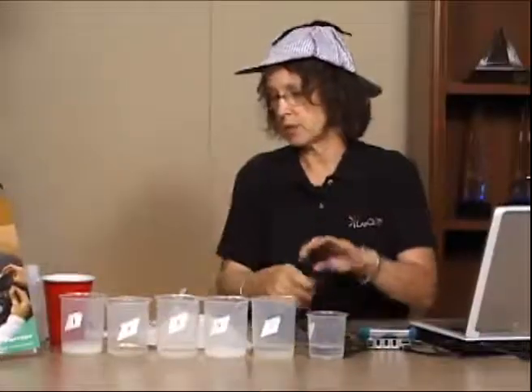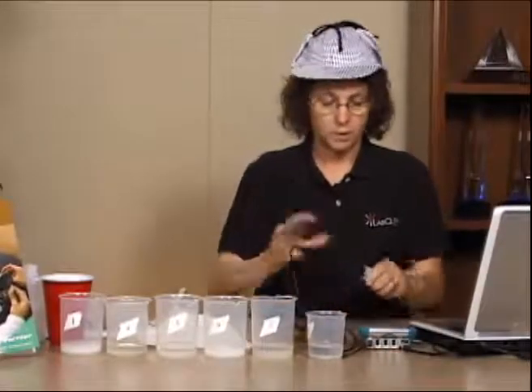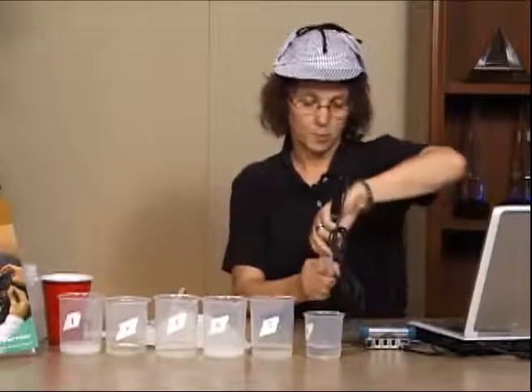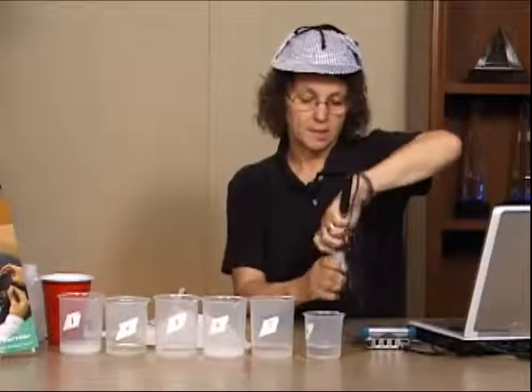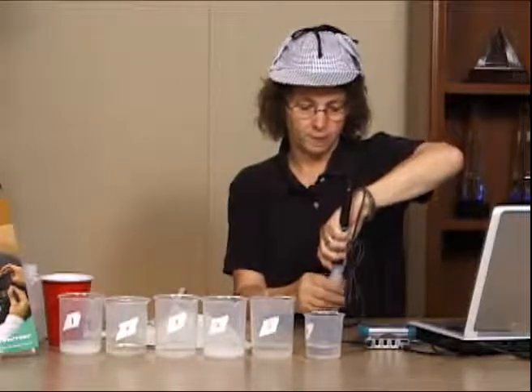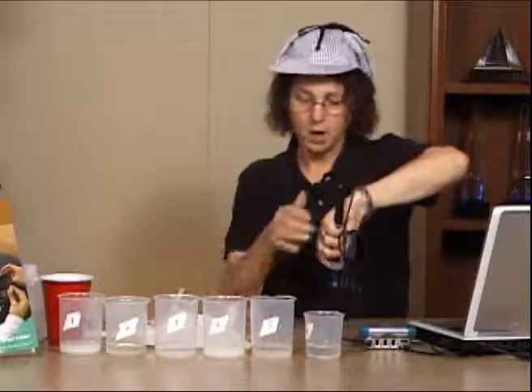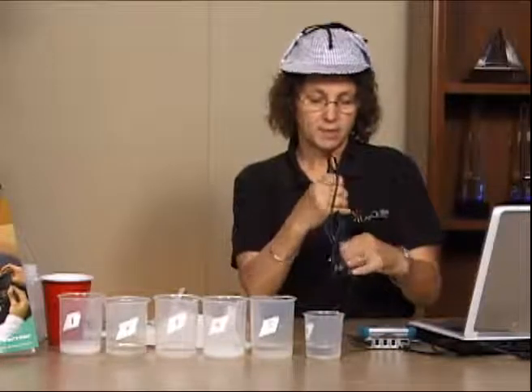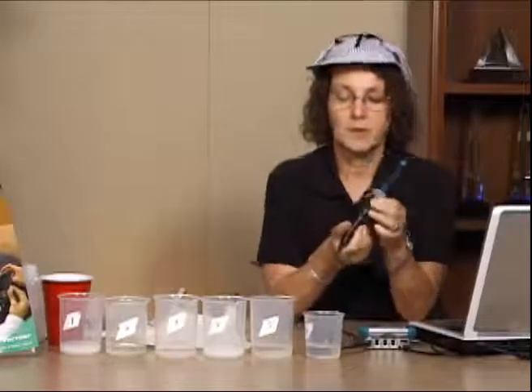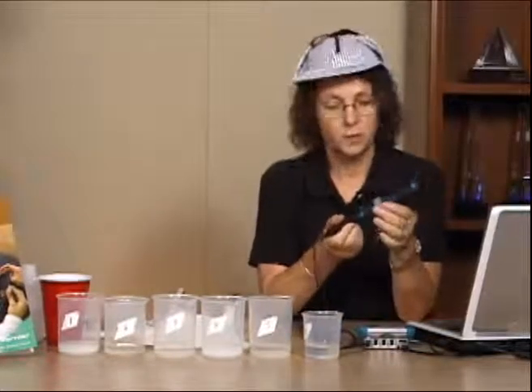So when you're using a pH probe, what you need to do is unscrew the pH probe here from the bottle. As a teacher, I've learned not to take the cap off. The reason I don't take the cap off, I simply push it up, is that I found that when I took the cap off, I lost the rings because the students weren't careful with them.